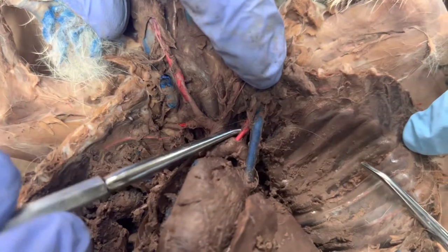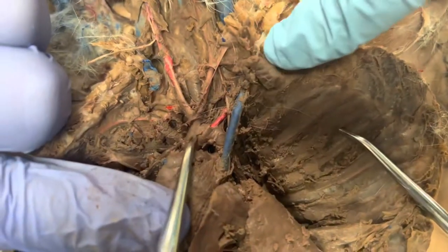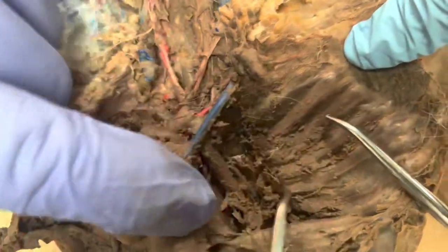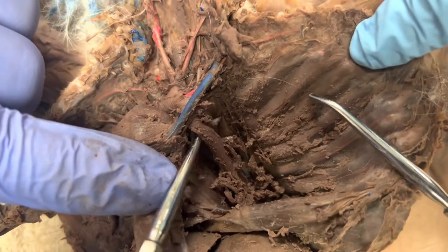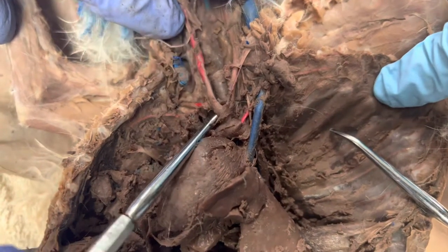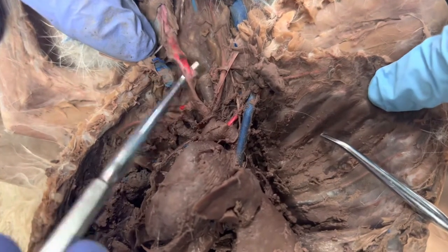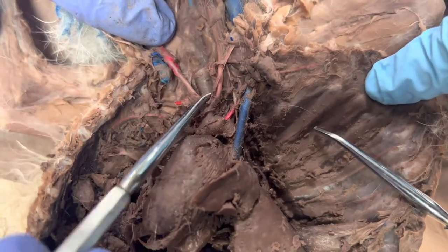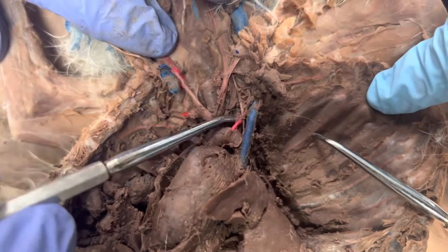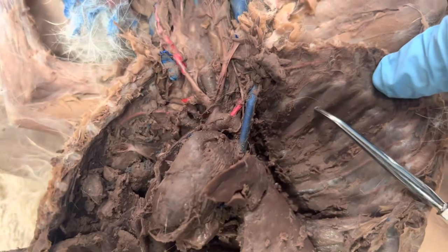Then I'm going to have my left subclavian artery, which goes into the arms. To review: this is my aortic arch, this is the ascending aorta, and over here I'm going to have my descending aorta — some books call this the thoracic aorta. I have my brachiocephalic trunk, my right subclavian, my right common carotid, my left common carotid, and then my left subclavian artery. That's it for the arteries of the aortic arch.